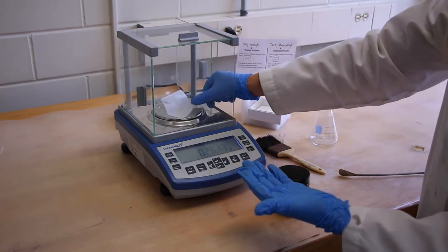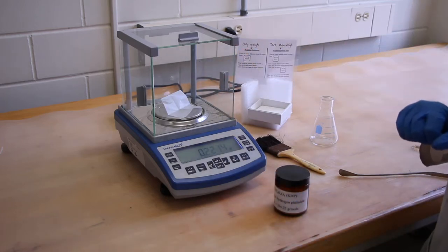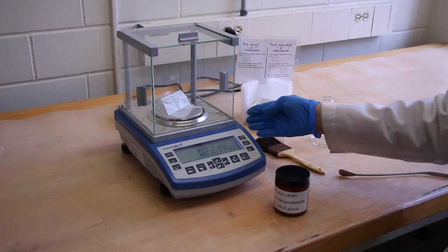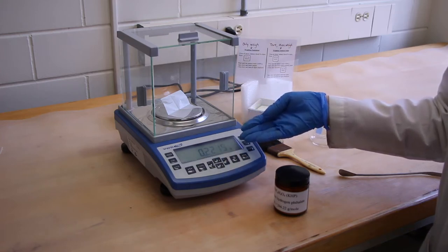We'll open up the door and we'll place our piece of weigh paper on the balance pan. And this is how much the paper weighs.